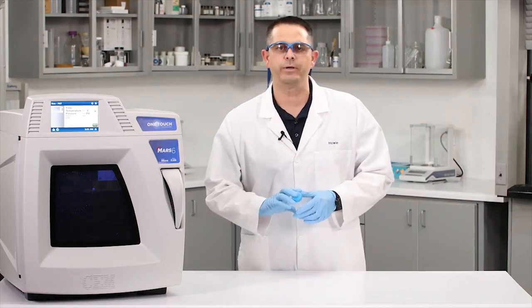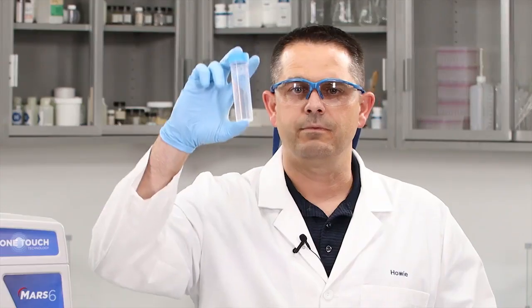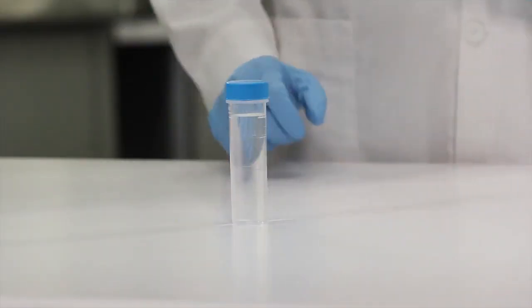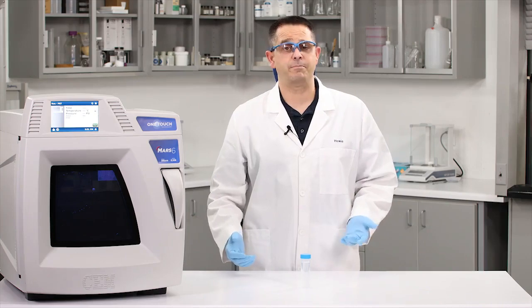Our dilution has been completed. Let's take a look and see how well we did. This PET with nitric only: clear, colorless, and particle-free. So can we digest a PET water bottle? Yes, and yes we can.